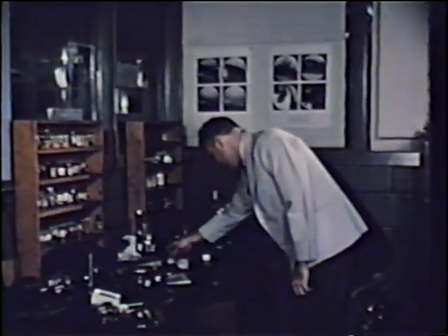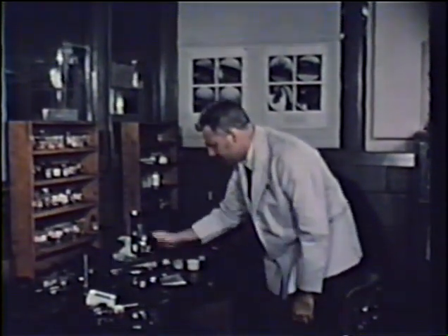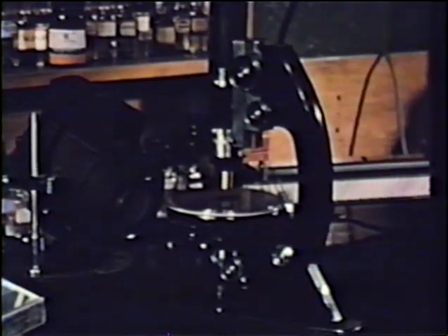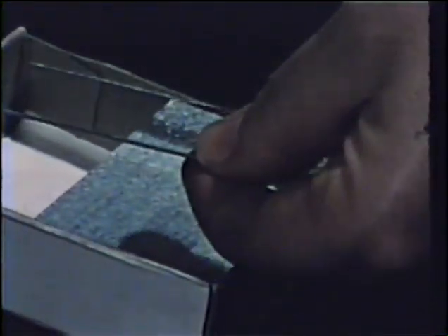All of the experiments shown thus far have involved pure compounds. The next series illustrates the mixed fusion, in which two samples are melted side by side on a slide so that the zone of mixing can be observed. This technique replaces the mixed melting point as an identity test and is also used for the determination of composition diagrams.